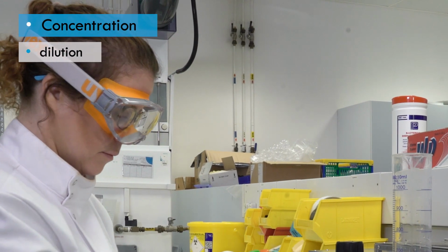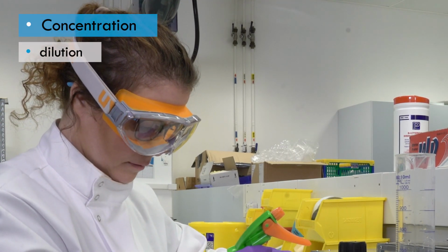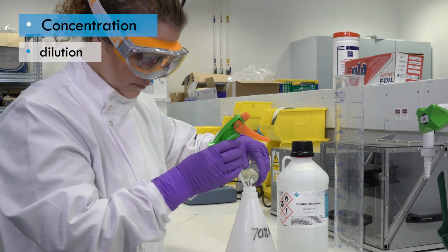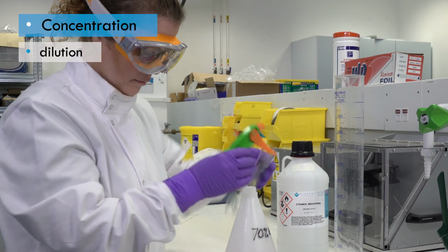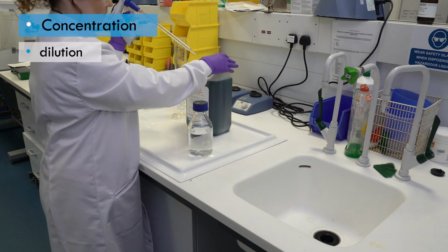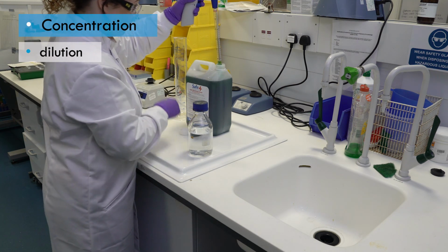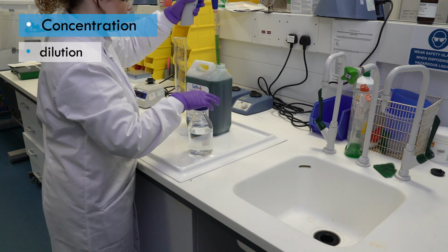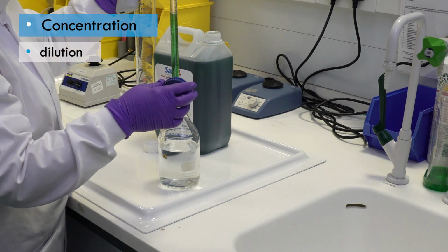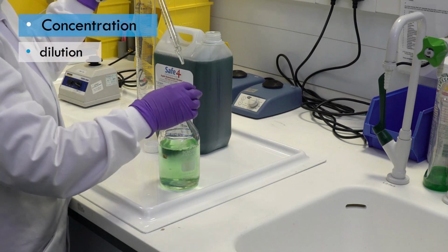Remember, most disinfectants will cause harm if they contact the skin, and they may also give off harmful fumes. Personal protective equipment should be worn, for example, a lab coat, gloves and eye protection. Disinfectants should be handled in a well-ventilated area or a biological safety cabinet, especially when handling the concentrated form. It's advisable to put the equipment on a tray to contain any splashes and spills.